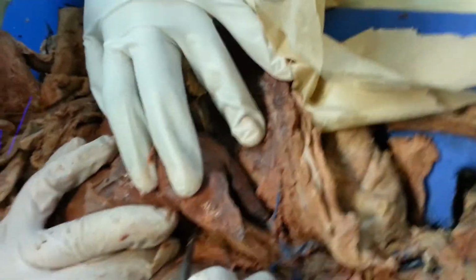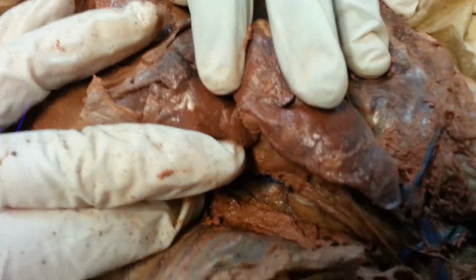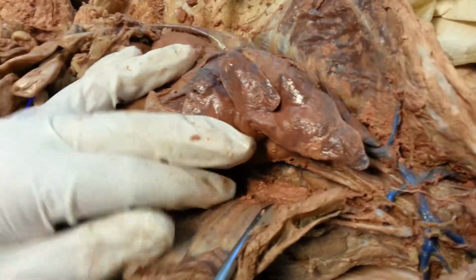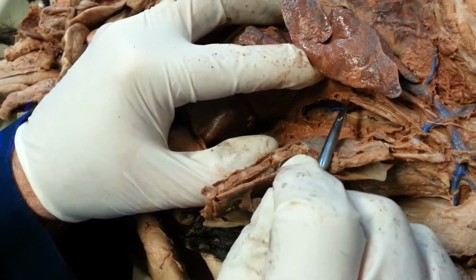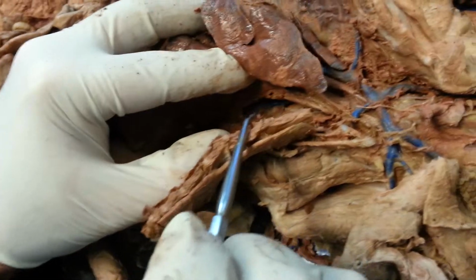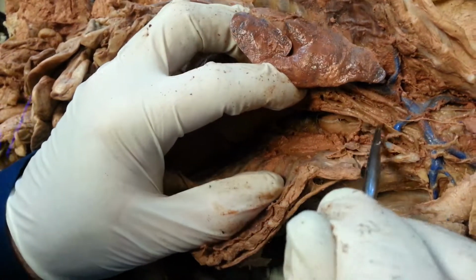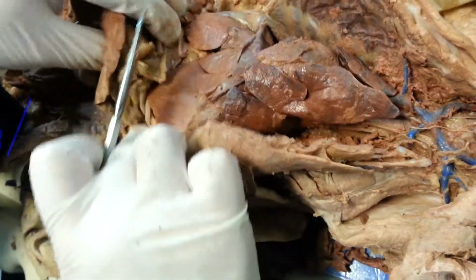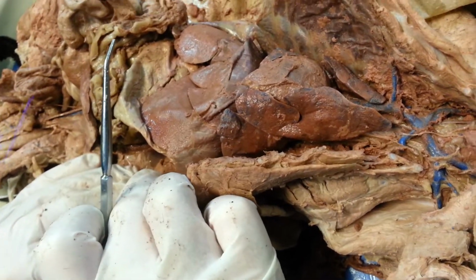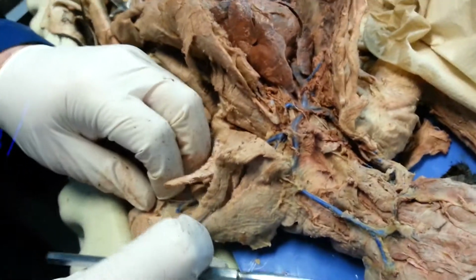Part of what we're seeing over here is the azygous vein, which helps to drain the chest. I can't remember if I asked you to know that or not. Yes, it's on there. It helps to drain the blood from the thoracic cavity. For the radial and ulnar veins, we'll be able to find that on the arm. You've got to go out in the arms and poke around in there.